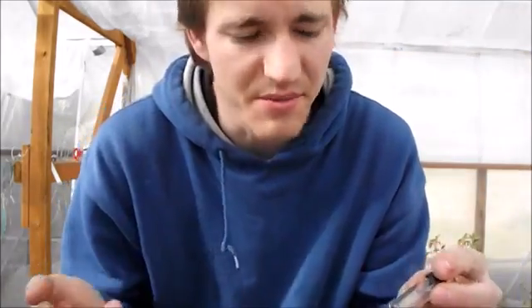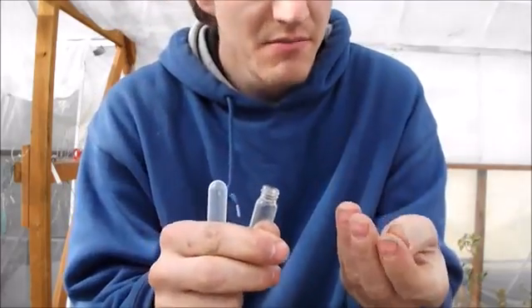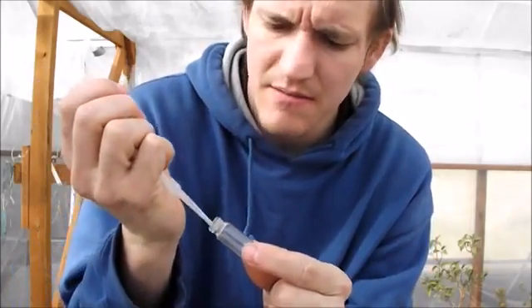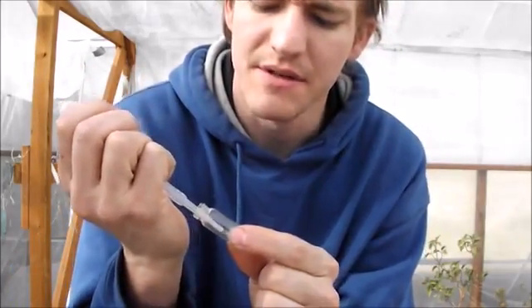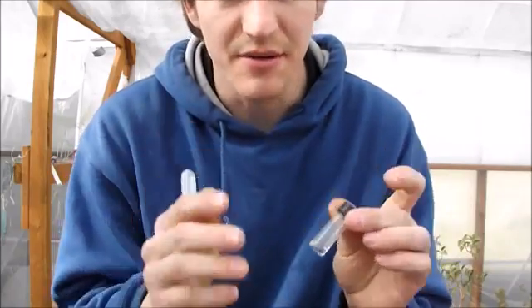It's taken me about two months and I've gone through over three liters of water. If you count the fact that I started with batteries, it's taken me years and I started with well over a gallon. Let's get a taste of this — mostly to see if it's salty, because if it is I'd have to redistill it, and redistilling this could be difficult. Hopefully it's not salty — and also heavy water is supposed to taste slightly sweet. Well, it's not salty and it does taste a little bit sweet, which is interesting. It's possibly just my imagination, but at any rate it's not salty, so we can go ahead and do some freeze tests.